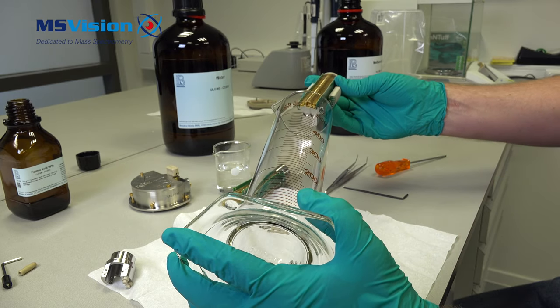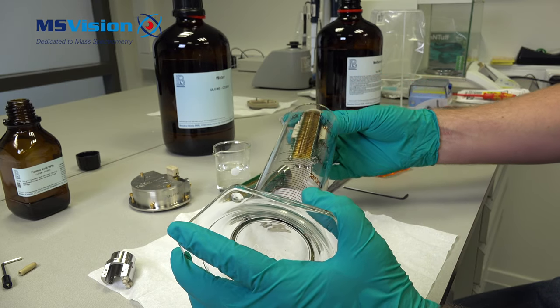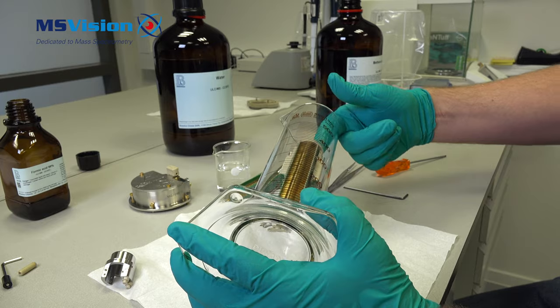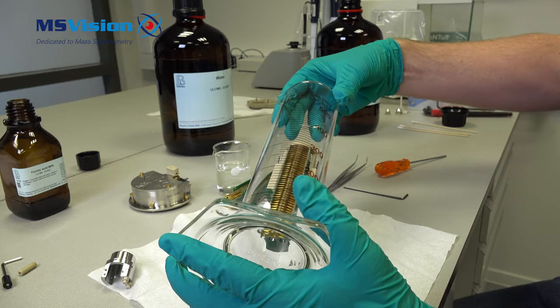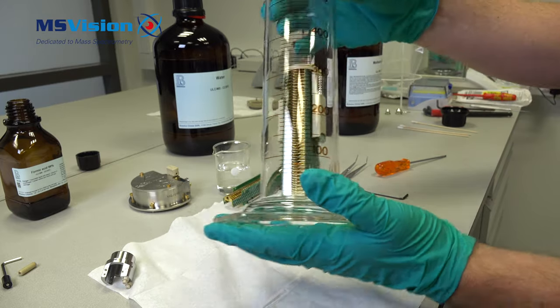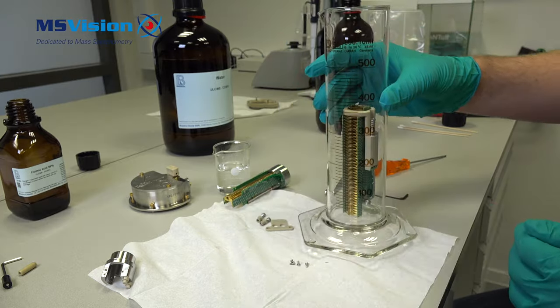This part can be put directly into a glass cylinder. Carefully place so that it stands on the PCBs. As long as the gold plated parts are not in contact with the cylinder, then it's fine.